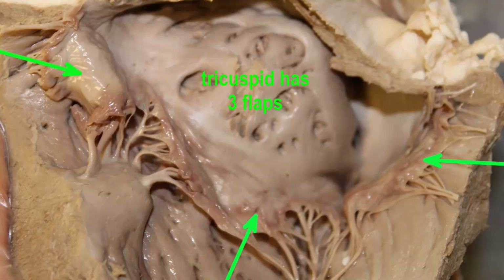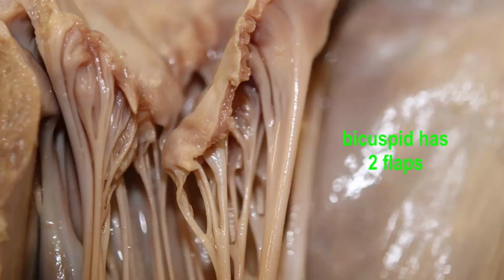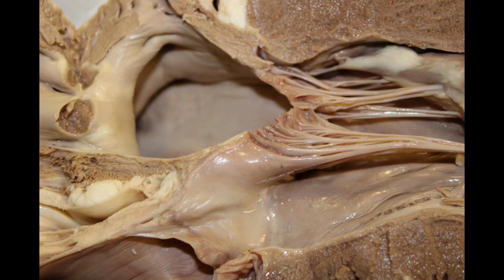Once you have identified a valve as an AV valve or a semilunar valve, the right AV valve separates the right atrium from the right ventricle and is also known as the tricuspid because of its three cusps. The left AV valve separates the left atrium from the left ventricle. It is also known as the bicuspid or mitral valve, the bicuspid because it has two cusps.